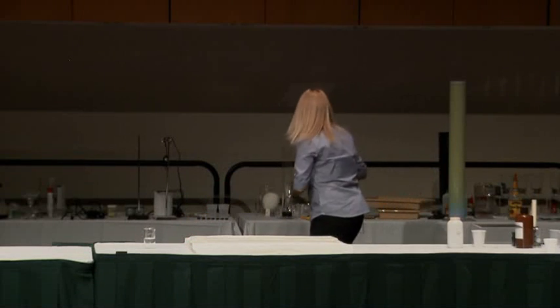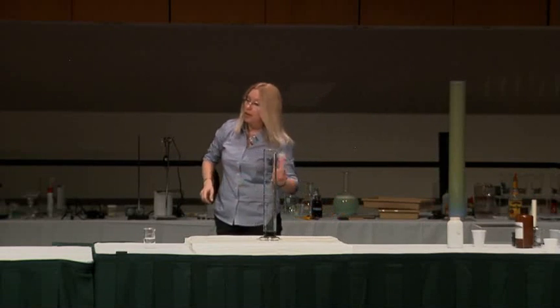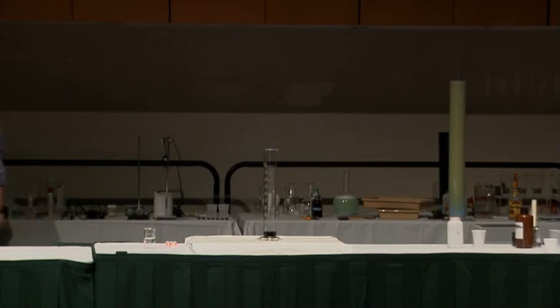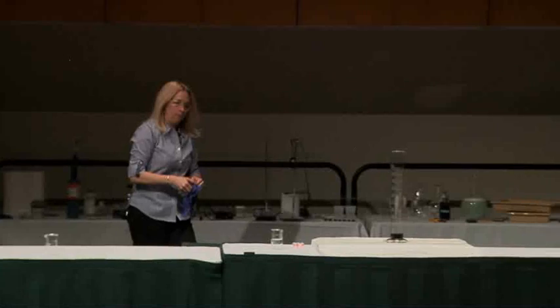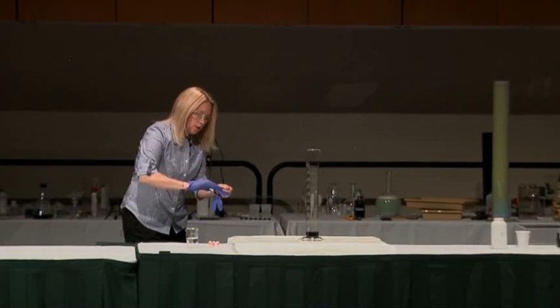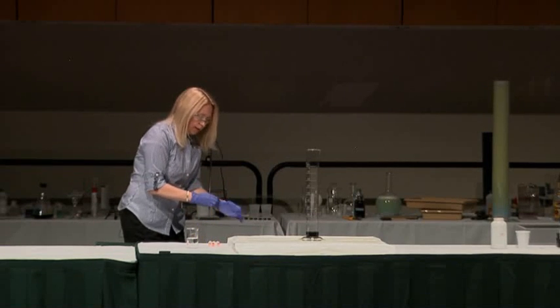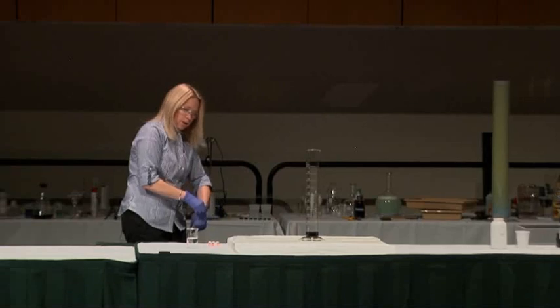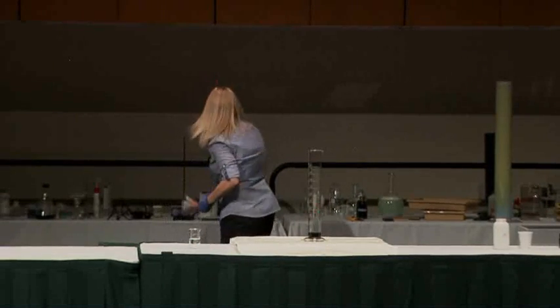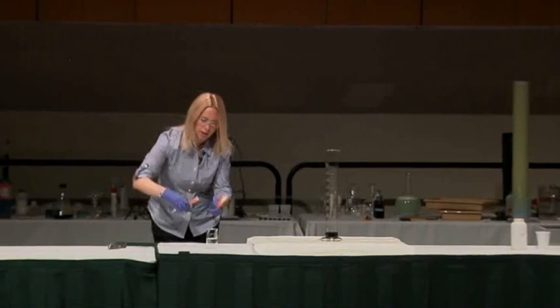We're going to do two things here. I've got some soap with some manganese dioxide in it. You can't use KI for this — it no worky. I'm going to put on some gloves. You need some 30% peroxide. I've got some soap and some manganese dioxide in the cylinder there, which is excellent. And I've got three high-intensity light sticks and a knife. Let's take those lights down.